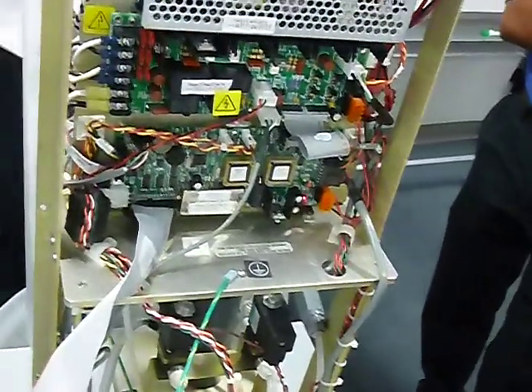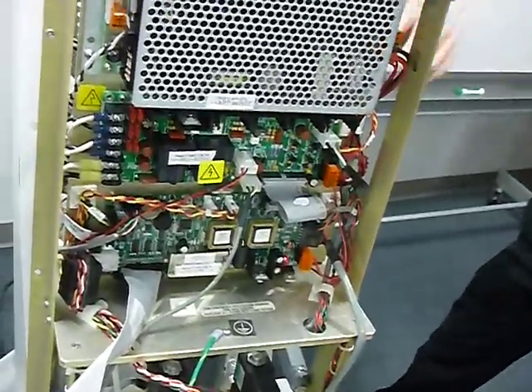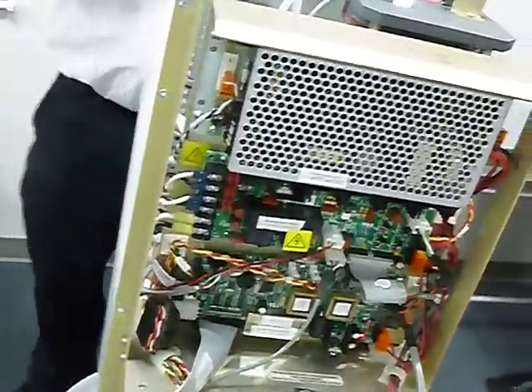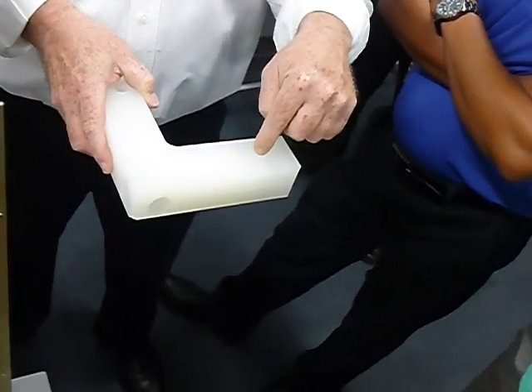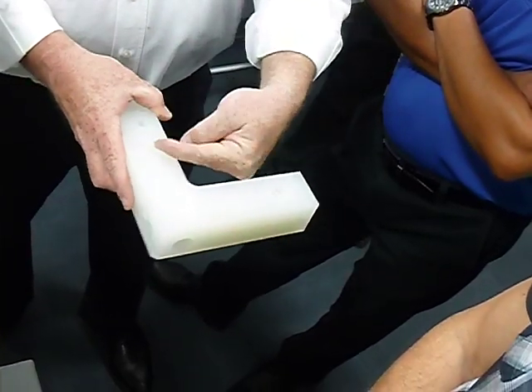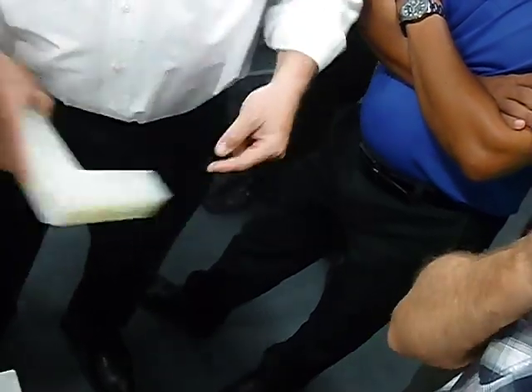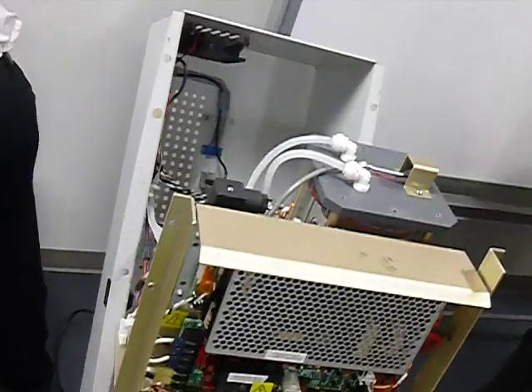So how many times does it pass by a heater? 2 times. 4 times. 2 heaters, 2 times per heater. 2 by 2, right? Yeah. If you come in here, the heater's here. All right, so it's gonna go down through the heater, come back through the heater again, up, goes back down, through the heater. Okay? And this is what the heater looks like.